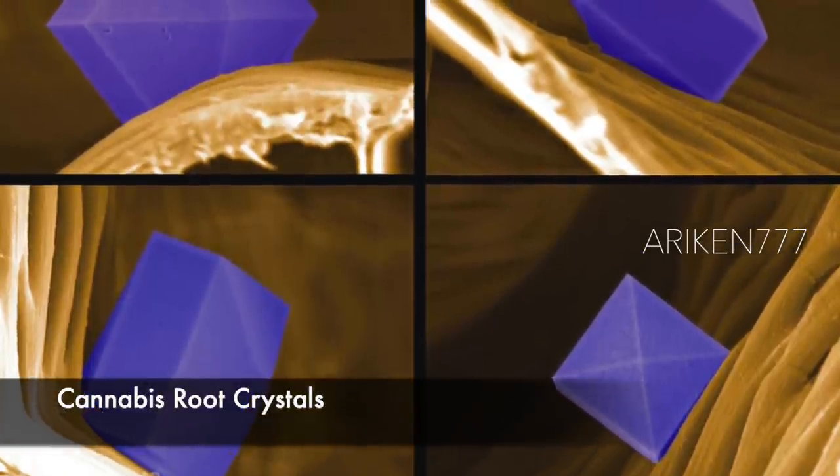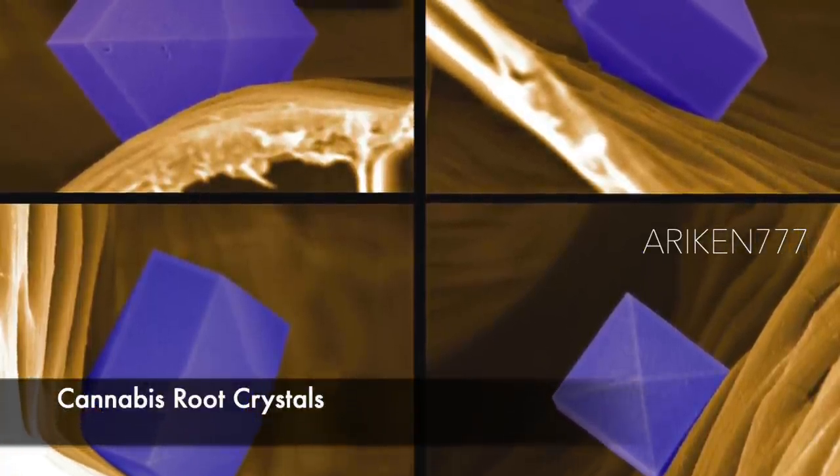These are crystals in the roots of the cannabis plant. The exact composition of these is currently unknown and their role in the life cycle of the plant is a mystery.